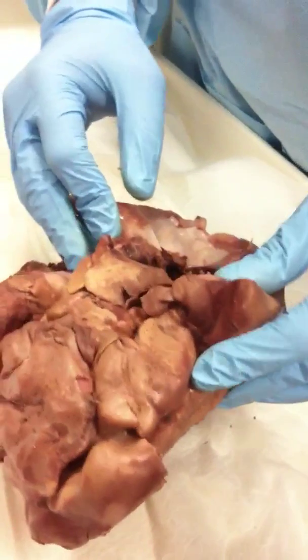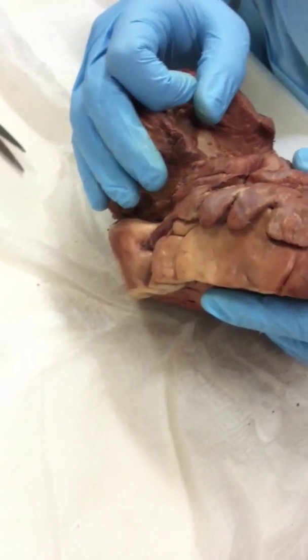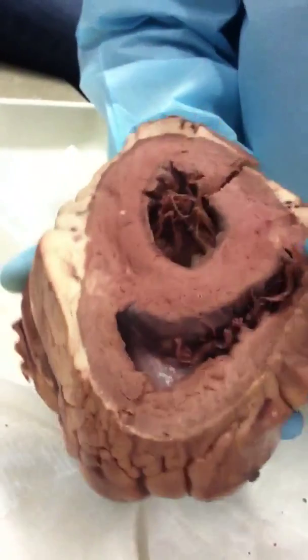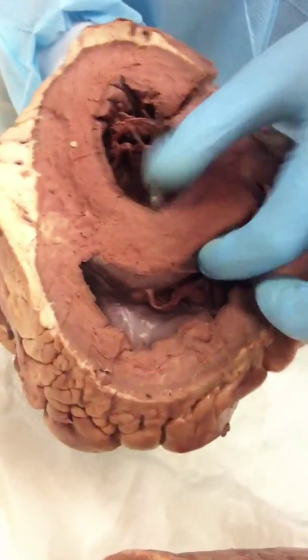What about the coronary sinus? No, you guys don't see the coronary sinus in the atriums? Oh, it's on the outside. Remember the venous blood of the myocardium drains into the coronary sinus? We have a nice coronary artery there. A couple coronary arteries inside the interventricular septum.